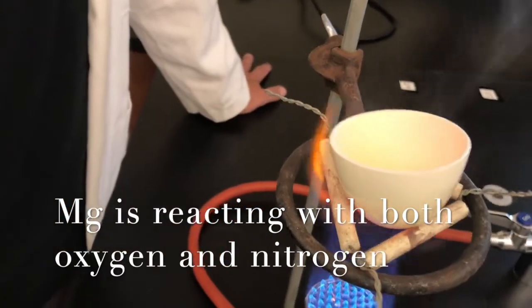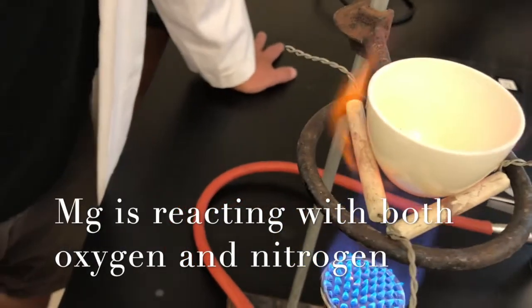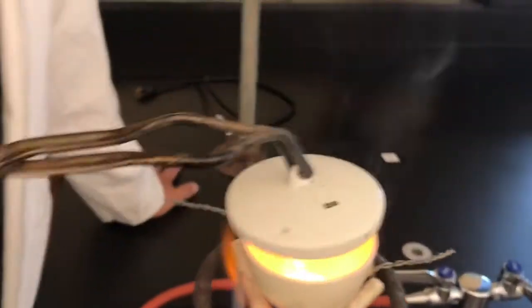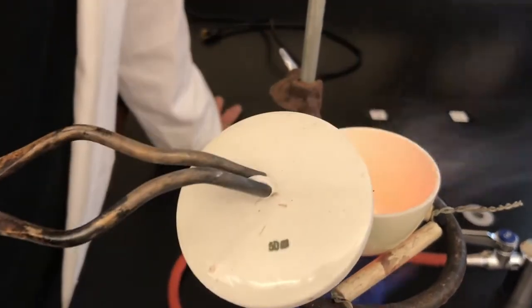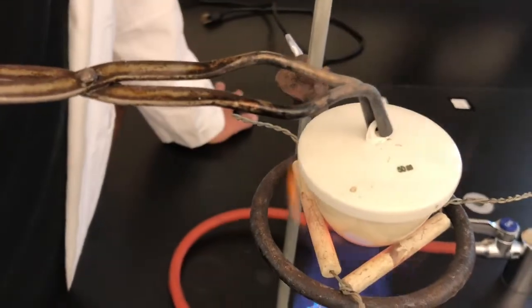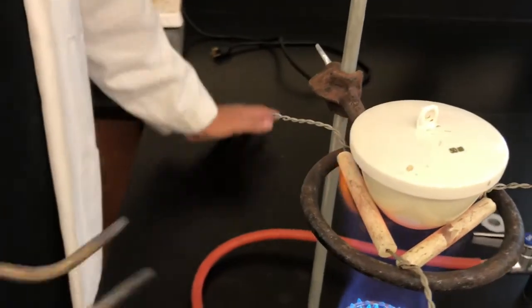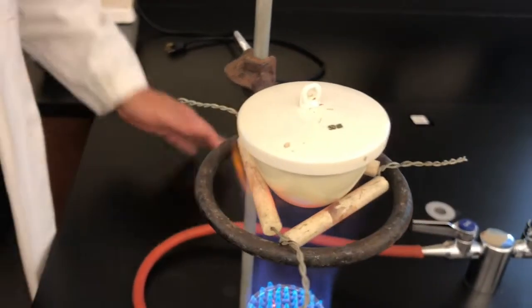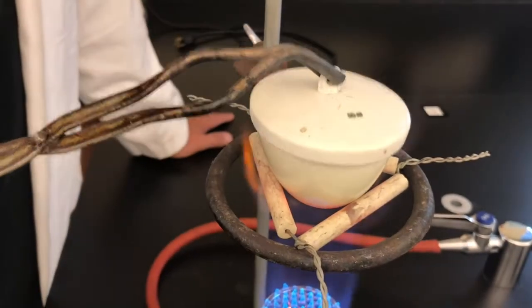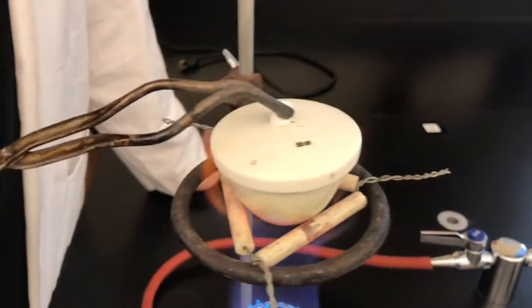What I'm doing — I'm cheating a little bit — I'm going to blow my breath into this. The temperature's really good. There's still some magnesium reacting in there. Now, that white stuff you see — that's some product. So we're losing some product here. This is a quantitative lab. We're going to want to see how close we are to the accepted value. I think what your teacher will have you do is figure out the percentage of magnesium in the product. The product's magnesium oxide.